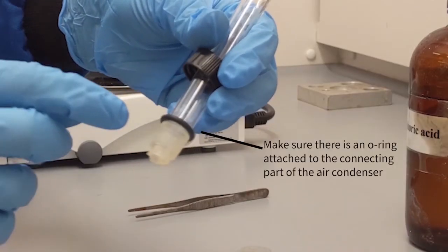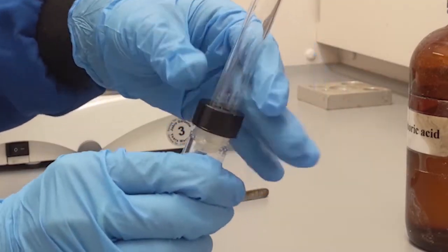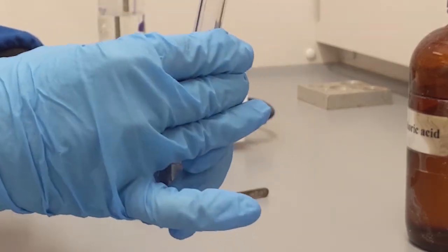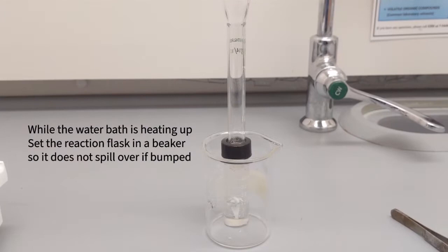And then connect your condenser on your conical vial. Make sure there is an O-ring between this connection. While you're preparing your hot plate to start the reaction, make sure you let this conical vial sit in a beaker so that it does not tip over.